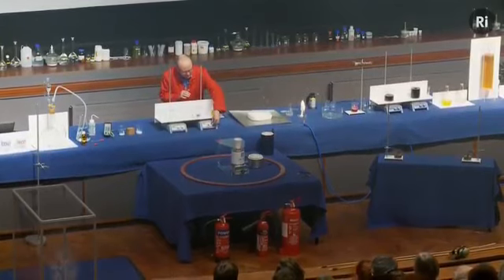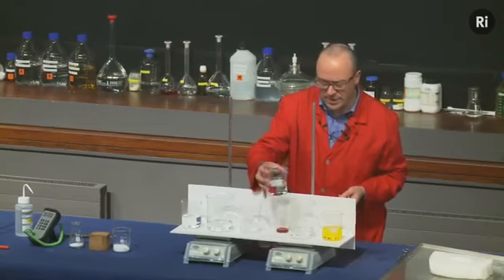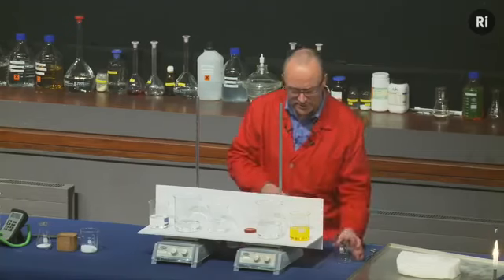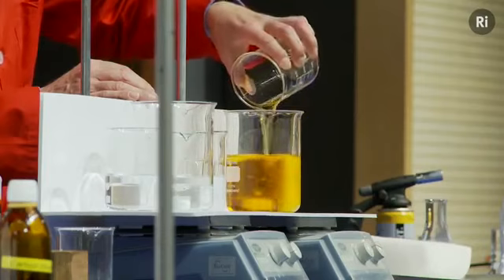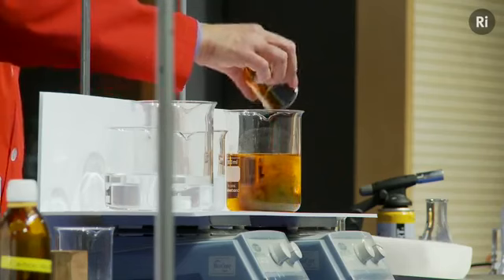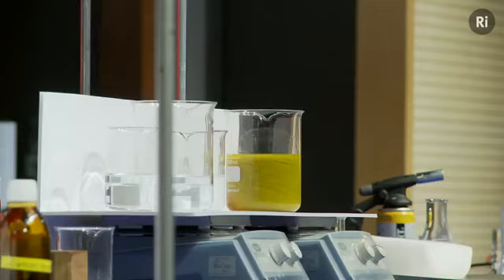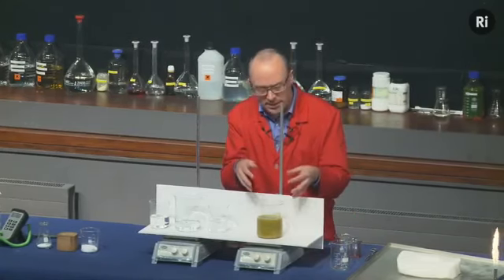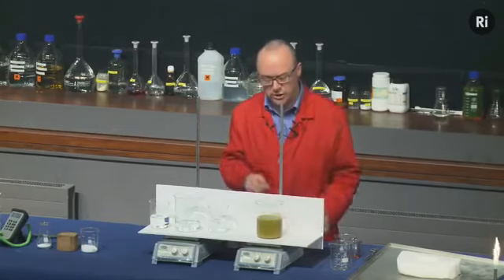So in this beaker is a colourless liquid. I'm going to add a second colourless liquid. It remains colourless. I'm going to add some yellow liquid, and it turns orange. I'm going to add a little bit of red liquid, and it goes sort of green colour, kind of muddy colour. Now in a minute or so, that muddiness will fade away, and we'll be able to see the colour of the solution. And what I want you to do is to watch the colour of this solution as it changes.